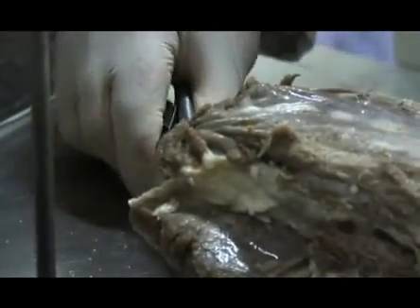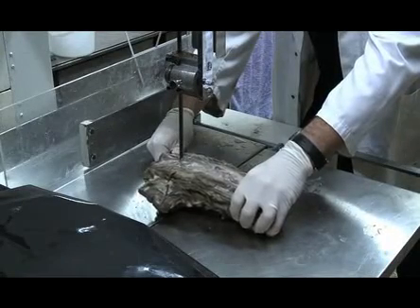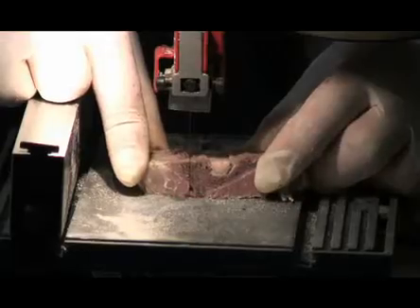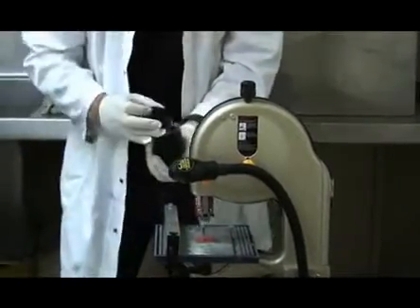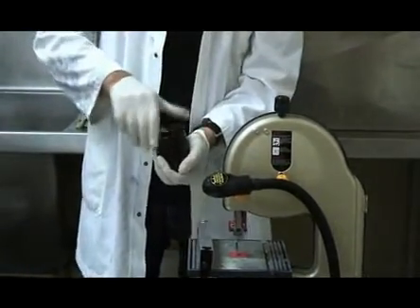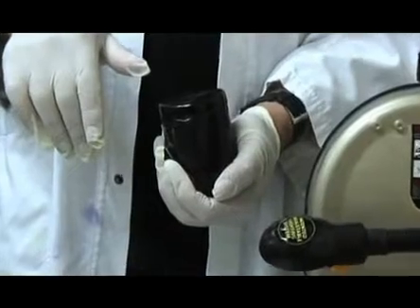Safety is very important and instruments should be used so that hands are kept free from the blade. The area of interest is now trimmed to size. Final trimming is then performed with a smaller bandsaw which results in less tissue loss. Once a block has been cut to size it is placed in a sealed opaque container containing fresh formalin to complete fixation. The volume of the container should be approximately 10 times the size of the specimen to achieve adequate fixation.